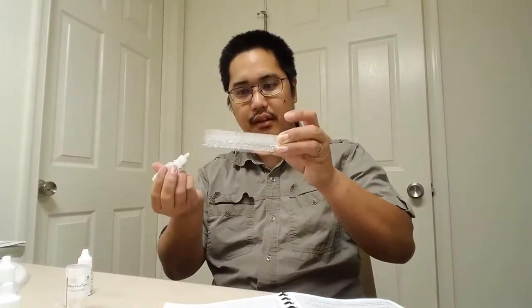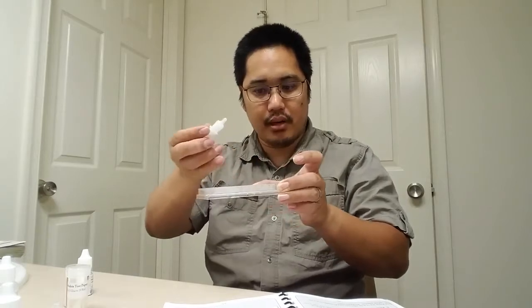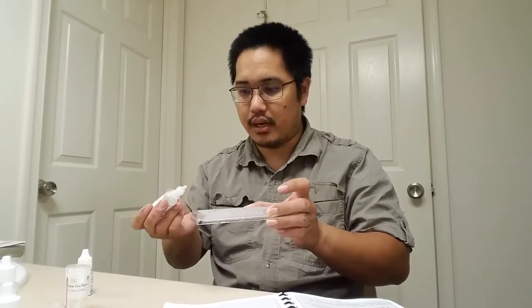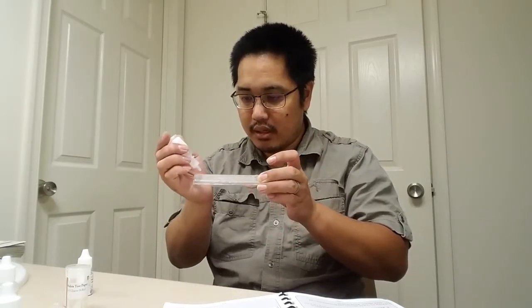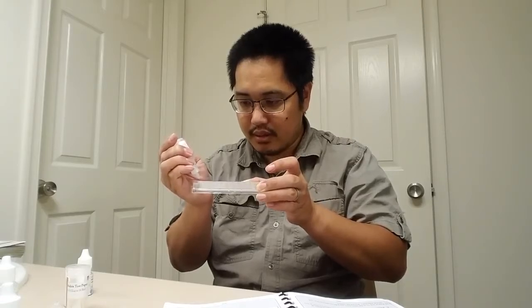All right, so they didn't really say this, but what I'm going to do is go to well H12. Now, I'm not using any of the stuff in here on the bottom corner. I'm only using this top part. So I'm going to use some other random well that I know I'm not going to use later. I'm going to put like 3 drops, 1, 2, 3 of pure sodium hydroxide.